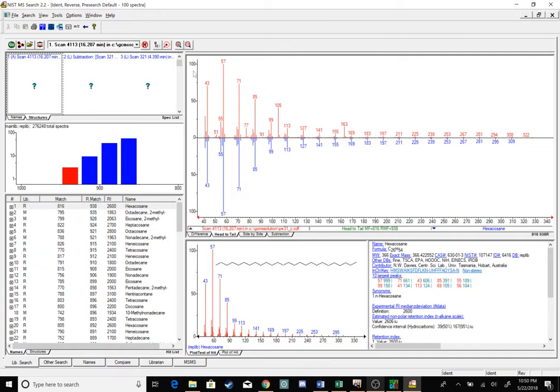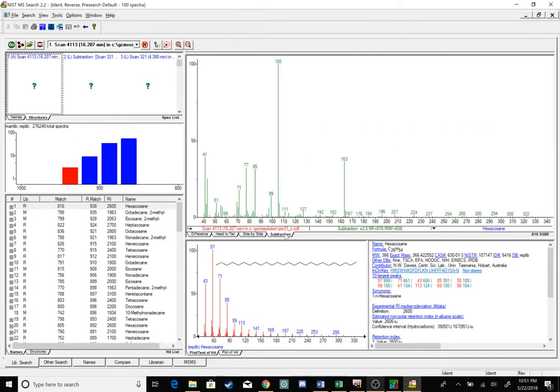So these are my same mass fragments. I have my 57 group, and I have my 105 as well. In blue, I'm making an identification for hexacosane. Everything sort of appears, but it doesn't have my 105 in that, or my 77 in that, or my 163. I want to see only the additional red fragments, so I'm going to click on my subtraction. This is my only additional red fragments.